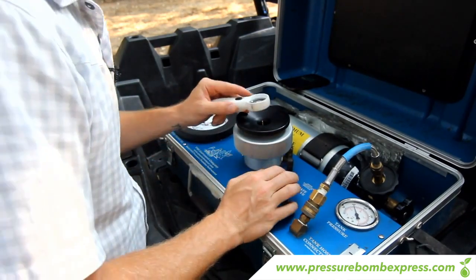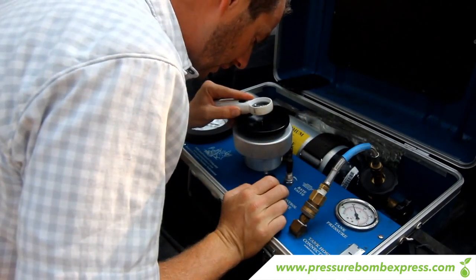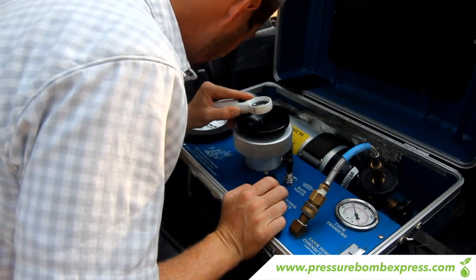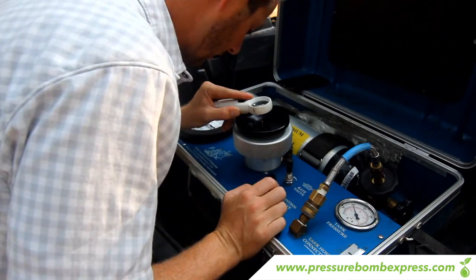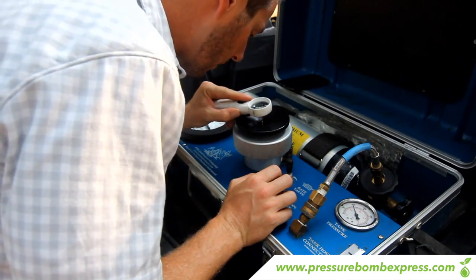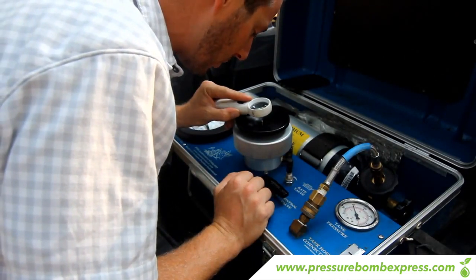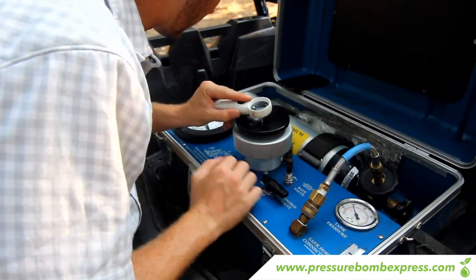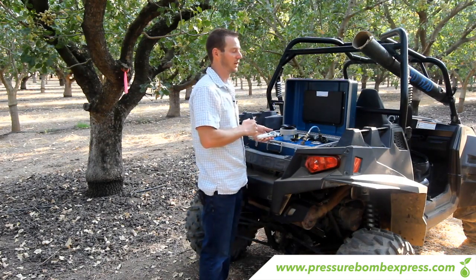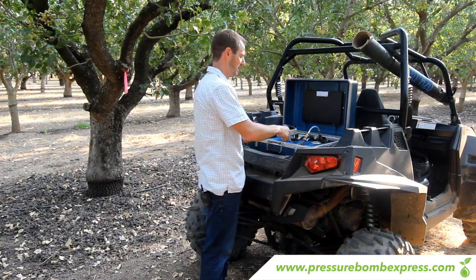At this point, take a look at the leaf under the magnifying glass, turn on the valve, and start letting nitrogen flow into the chamber. You'll watch the tip as well as looking to the left to see how many bars are building — it's a constant back and forth. If there's phloem, wipe it off and keep going. Once you have clear liquid coming out the top building a bubble on the surface, that's when you stop the nitrogen flow and take your reading. You would take your bar reading and either write it down on your manual input form, plug it into the Pressure Bomb Express program at the office, or use your cell phone to input the location and reading.